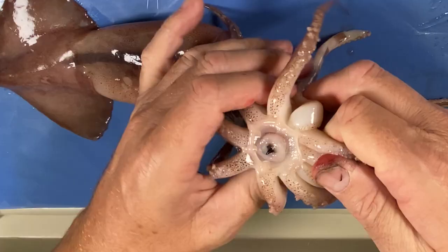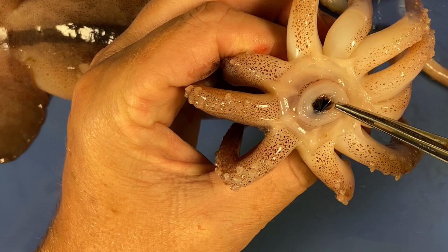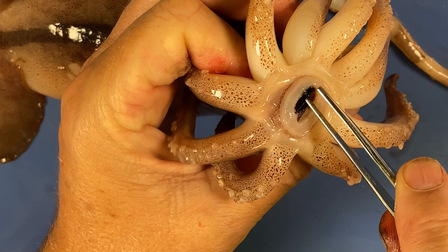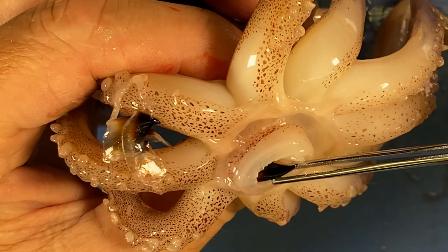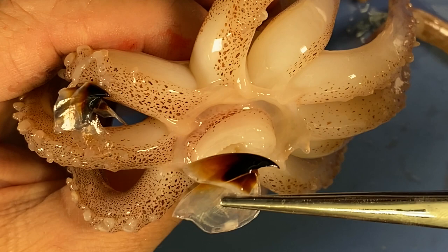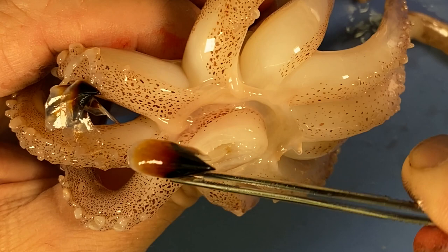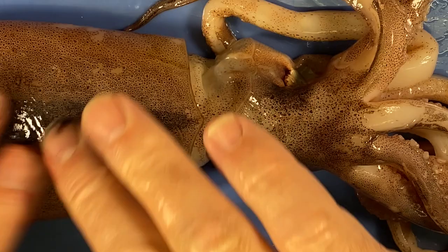I bet it's got a nice big beak — whoa, look at this, that's just brilliant! Just look at that — that's some serious business there. It's quite hard. I'm going to pull it out — see if it will come out easily. Look at that — that's going to chomp up whatever the animal's eating into little bits so it can swallow it. That's some serious business. Usually when it's dark in color that's often melanization — melanin — and that may contribute to the hardness of these structures.